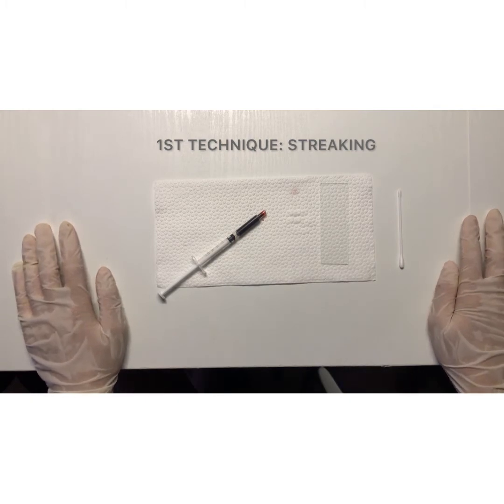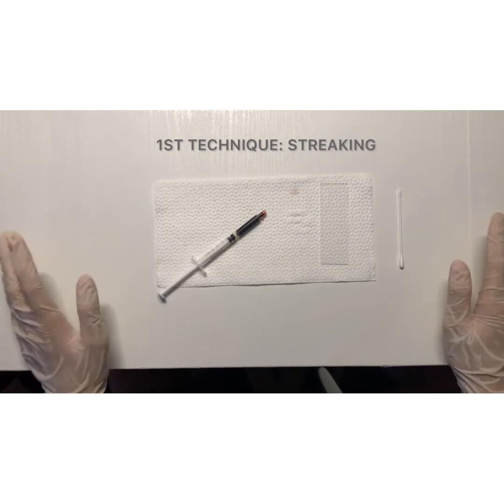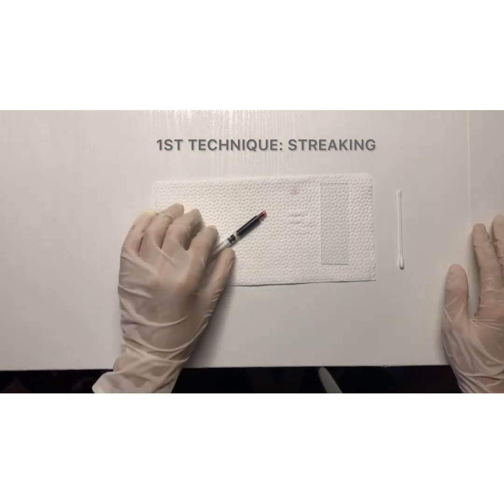So first, I will pour a small amount of the specimen, the pig's blood, on one end of a clean glass slide.